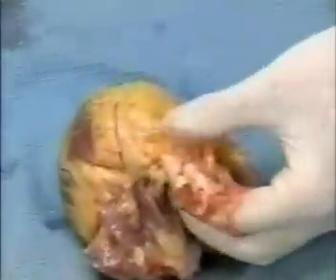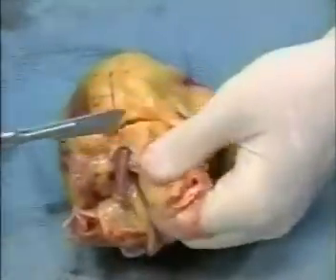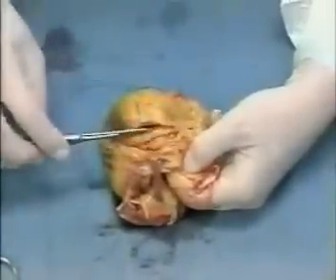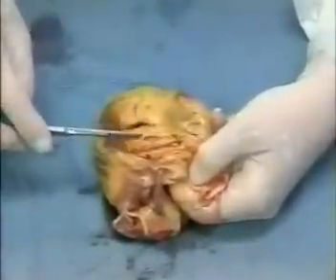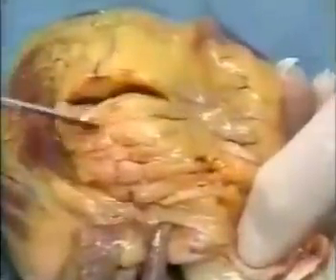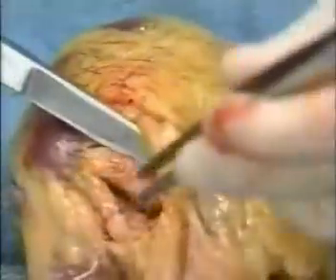Dr. Fricke is now examining the heart. The first thing she'll be doing is looking at the coronary arteries to make sure they're intact and that there are no signs of thrombosis or atherosclerosis. The artery she's dissecting right now is called the left anterior descending artery — this is the vessel that supplies the anterior portion of the left side of the heart, the main pumping chamber. Representative samples of the various tissues examined will be saved in formaldehyde, and that's what you're seeing her do right now.